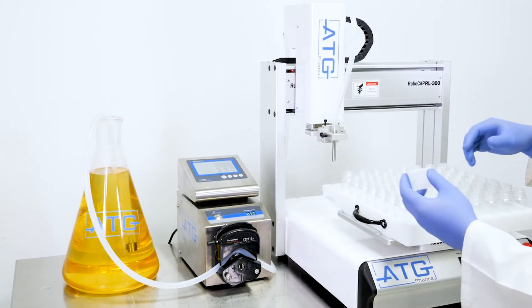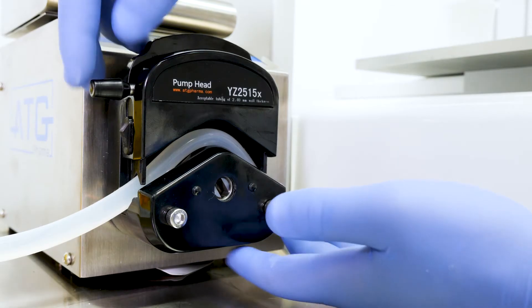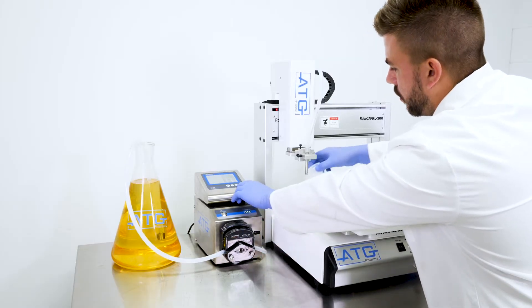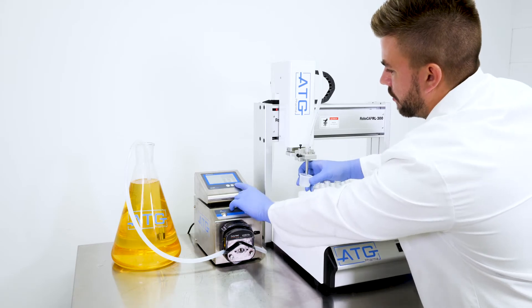Next we will prime the lines with a test cup. Close the latch on the pump head. Press and hold the purge button with the test cup underneath.